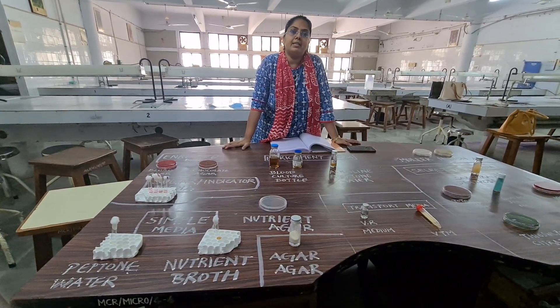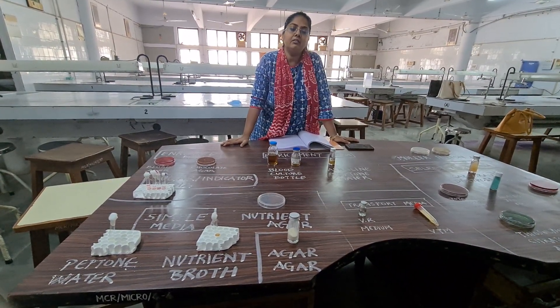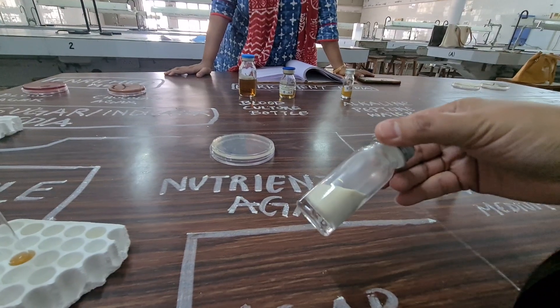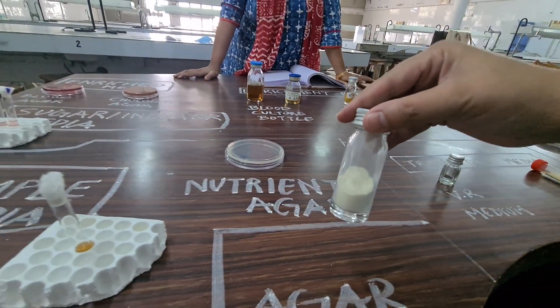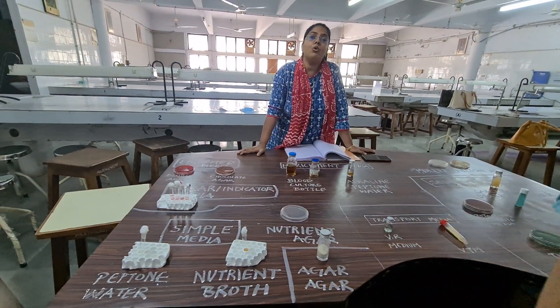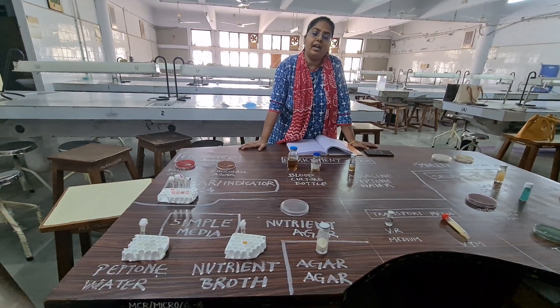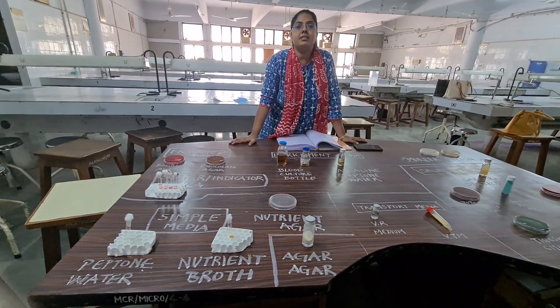There are basic substances required to make media, like agar agar. This is agar agar in powder form. It is also available in flakes and it is used for solidifying the media. It is a non-nutritional substance with the property of gelling at 45 degrees centigrade and again liquefying at 91 degrees centigrade.